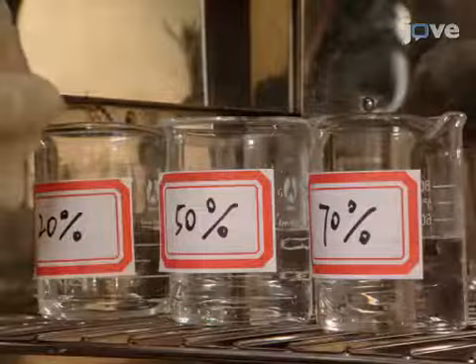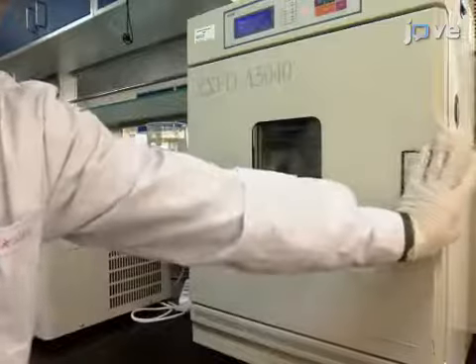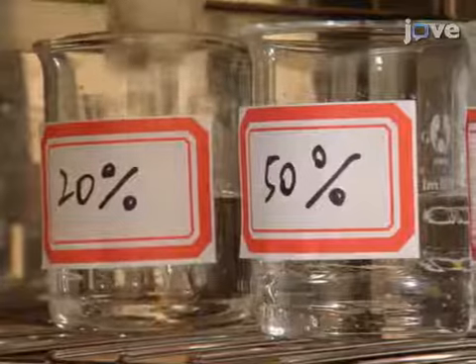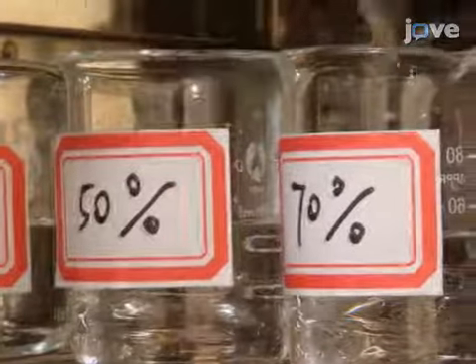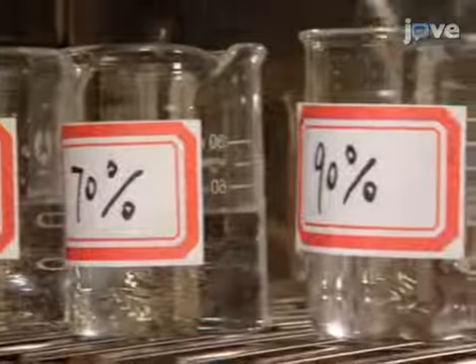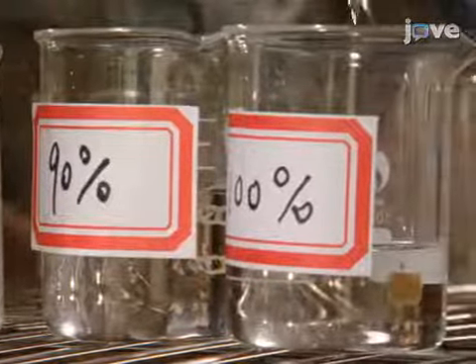Incubate the tissue in a series of graded PEG baths to displace the water and allow the PEG to infiltrate: 20% PEG for 1 hour, 50% PEG for 1 and a half hours, 70% PEG for 2 hours, 90% PEG for 2 hours, and 100% PEG for 10 hours.